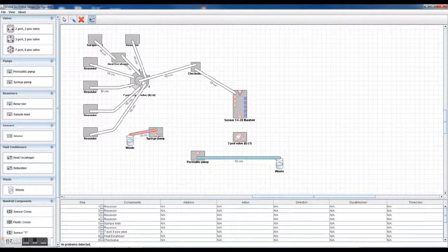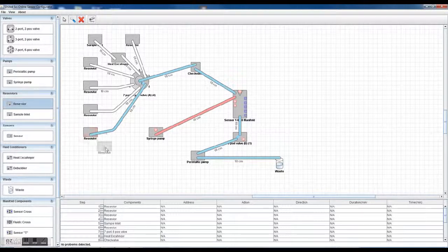Now I'm going to do some simple plumbing here. I'm going to put it also into maybe the second inlet port, and maybe plumb up the outlet ports properly. You can see here there's a fluidic connection going on here, and maybe also, this is not waste, that would be like an inlet fluid, so I would have a reservoir there instead, and I'd have a waste container over here, of course, and just make and break fluidic connections. So you can see how easy this is.